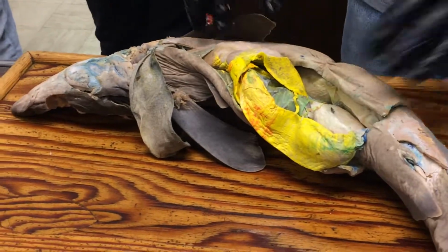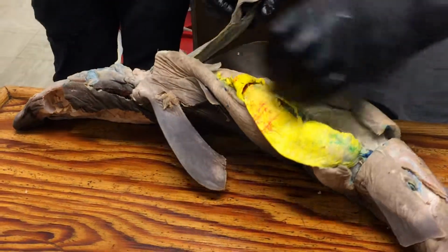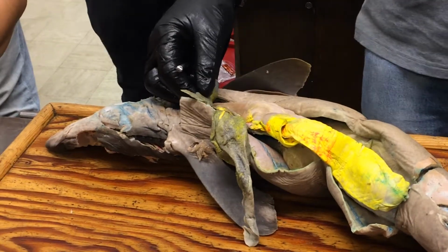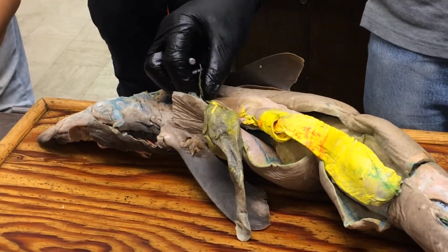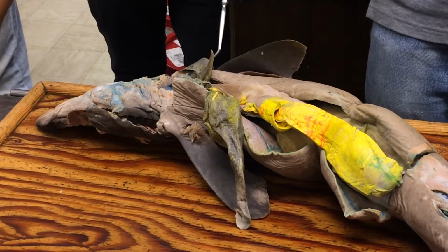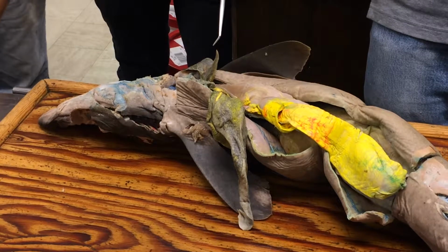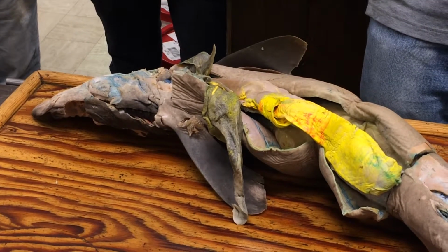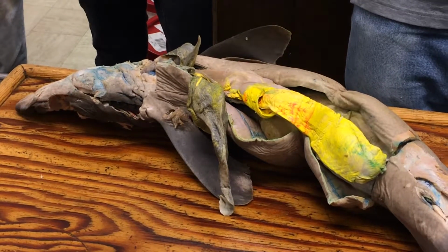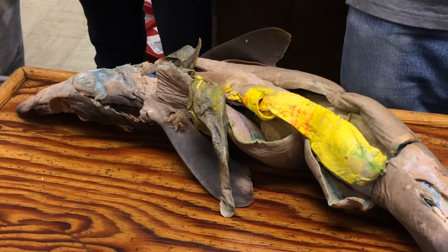The liver has lobes. There's a left lobe, a right lobe, and a median lobe. What's in the median lobe that's extra special? The gallbladder. So that's where we see this thin sac. That's the gallbladder that's just storing bile. And the bile duct we also already saw running through the lesser omentum down to the gut.